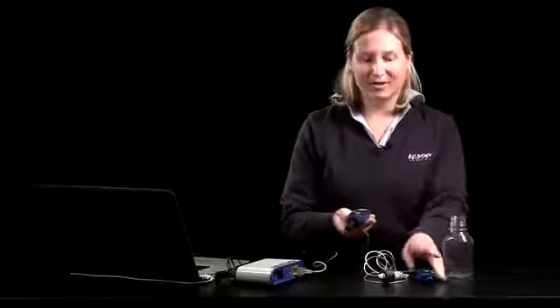My name is Cynthia Sargent, and in today's video we'll be looking at the carbon dioxide and oxygen gas sensors. You can use these for a number of activities in your classroom. And just a basic introduction to the sensors and calibration.